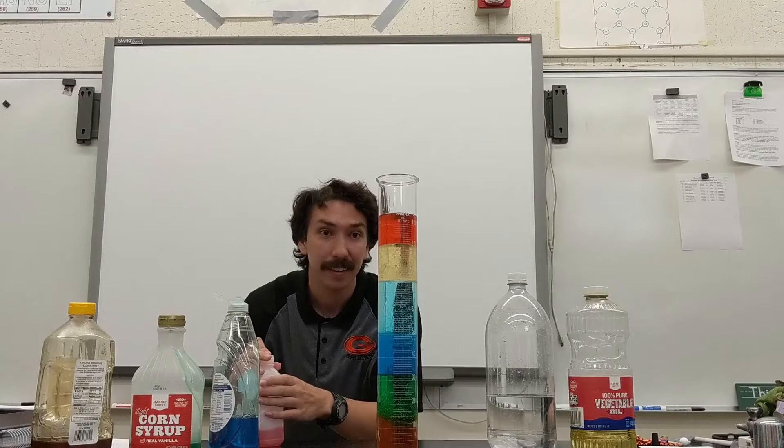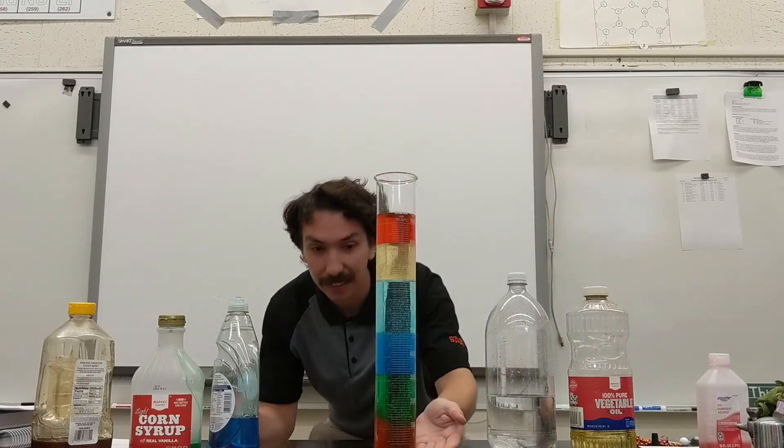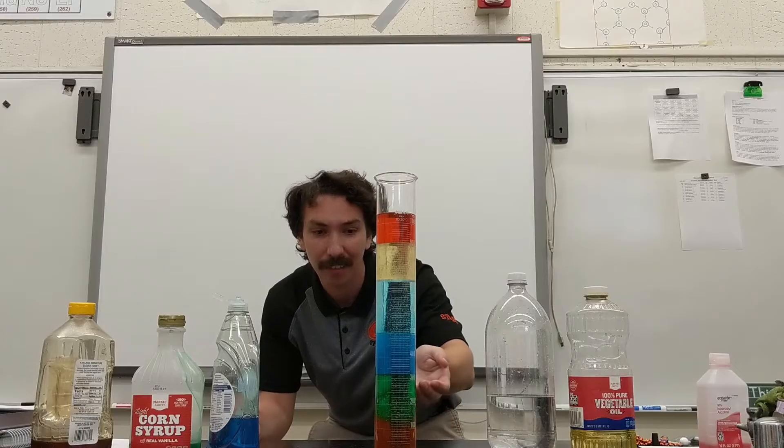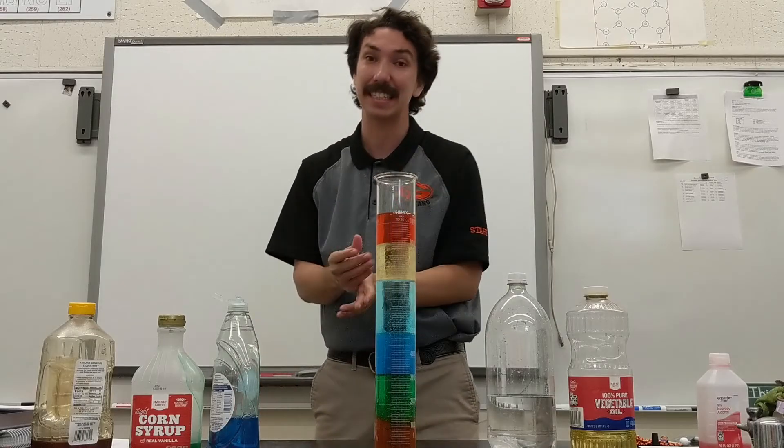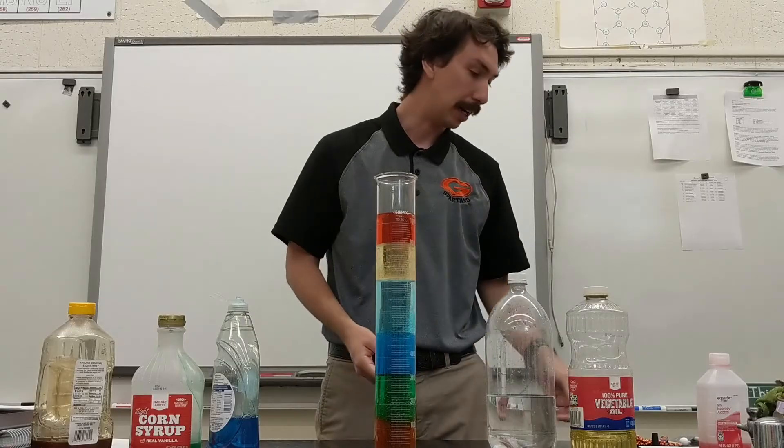So now that we've made our density column, we have one, two, three, four, five, six nice layers now with our most dense on the bottom and our least dense on the top.